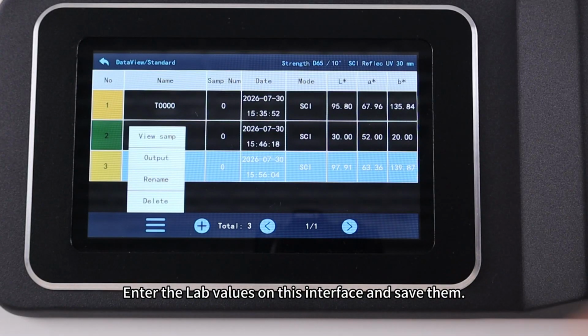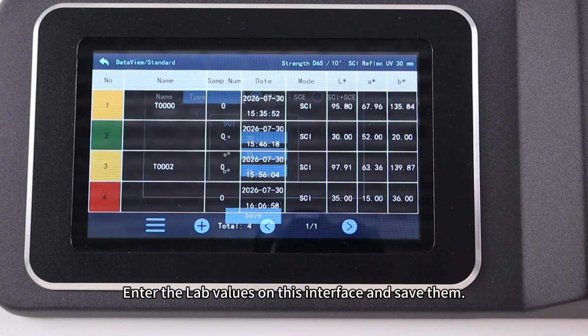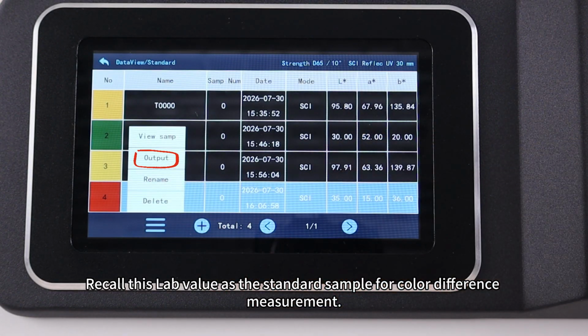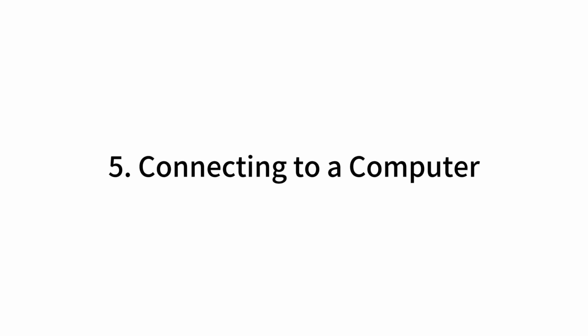How to manually add LAB values. Enter the LAB values on this interface and save them. Recall this LAB value as the standard sample for color difference measurement. 5. Connecting to a computer.